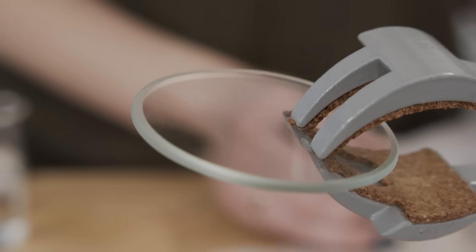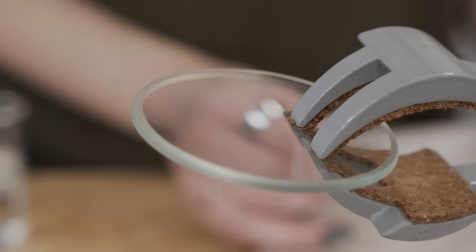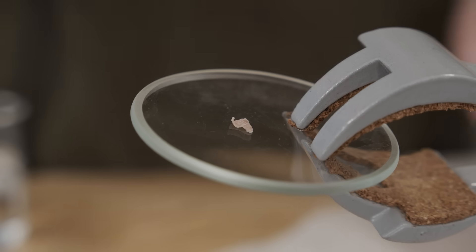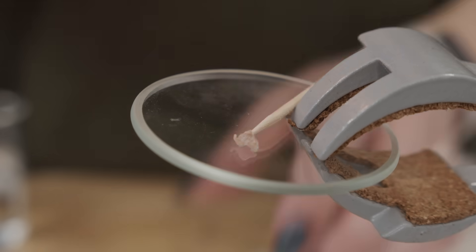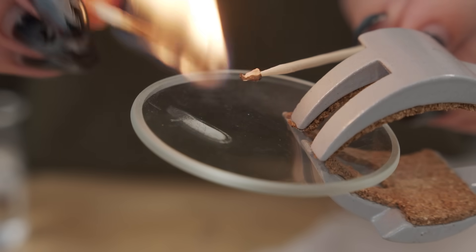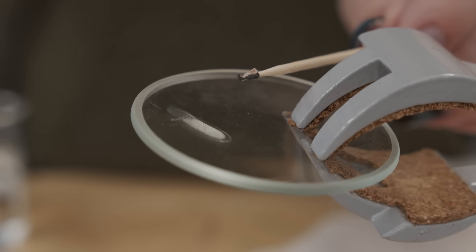Just for fun, this is a piece of pretty pure DNA — this is the one I wound off of the spool last night from the strawberries. And when I let that pellet catch on fire, it burned, but it also went out pretty quickly. This feels like good evidence that coating clothing in it might also act as a flame retardant.